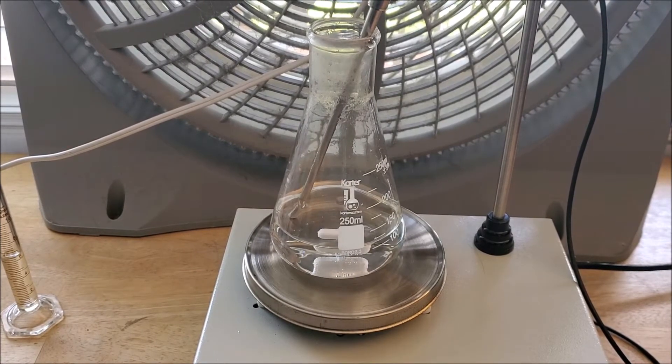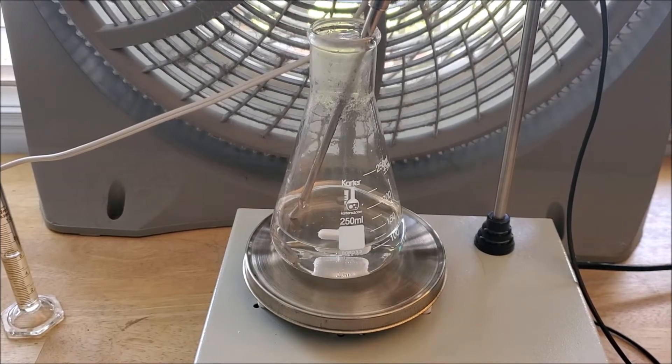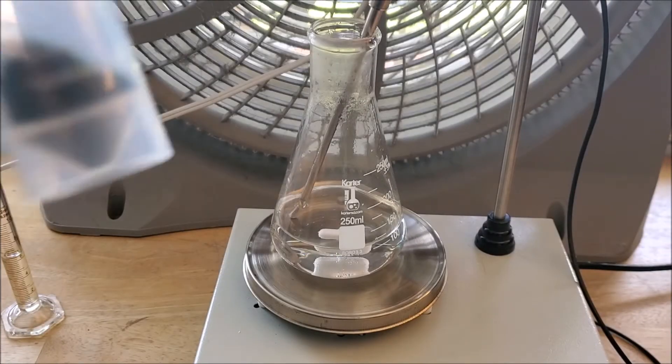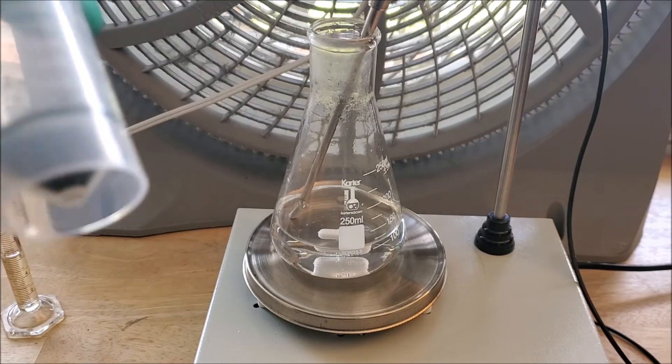First thing you're gonna need is 2.8 grams of chromium-3-chloride. You can see it here, it's a nice green powder. It's relatively easy to get, I got mine on ebay.